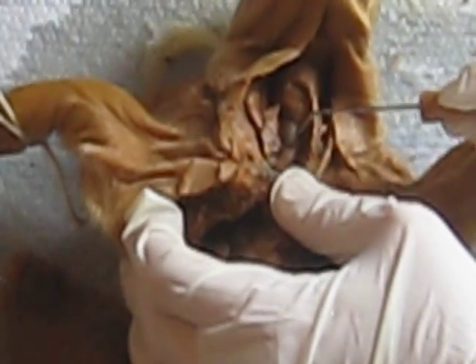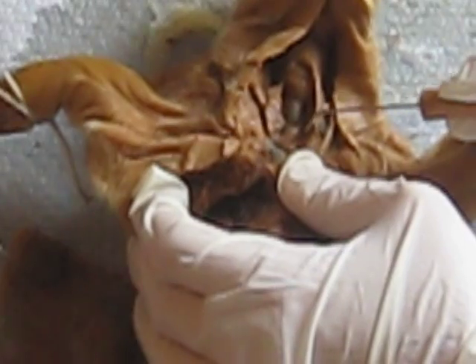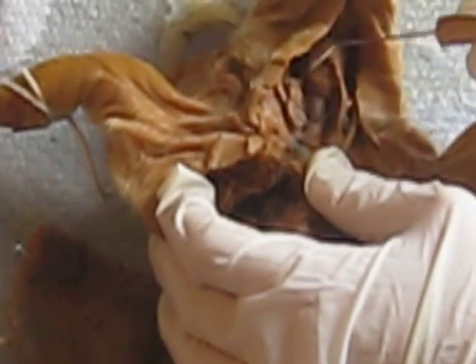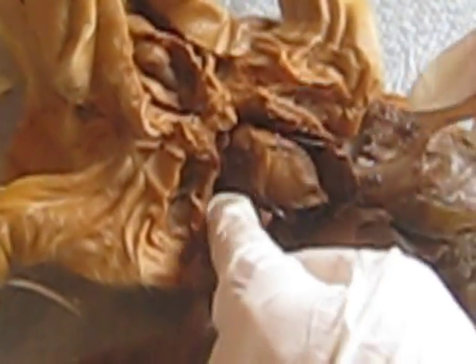Now this little organ right here is the thyroid gland, and it sits kind of at the bottom of the trachea. And then around the trachea right here is the thymus gland, and also a part of the thymus gland is right here on top of the heart. It's enlarged in the fetal pig. And there it is. So now moving still inferiorly, surrounding the heart on either side are the lungs.